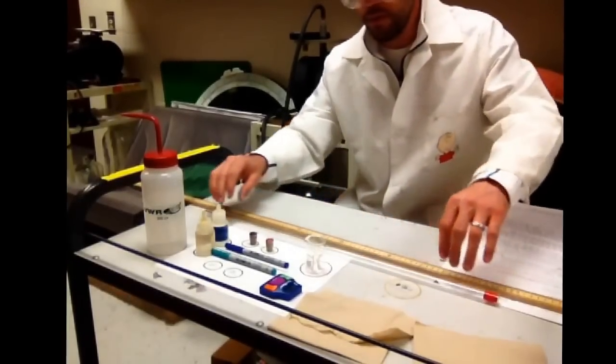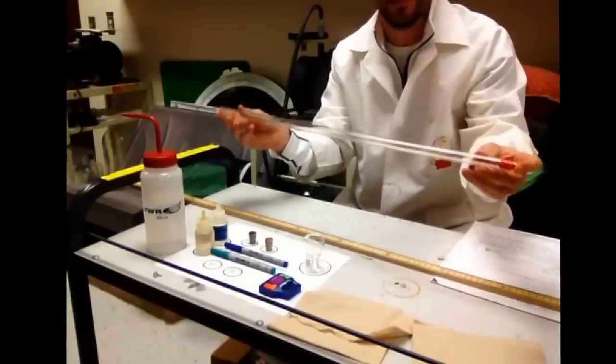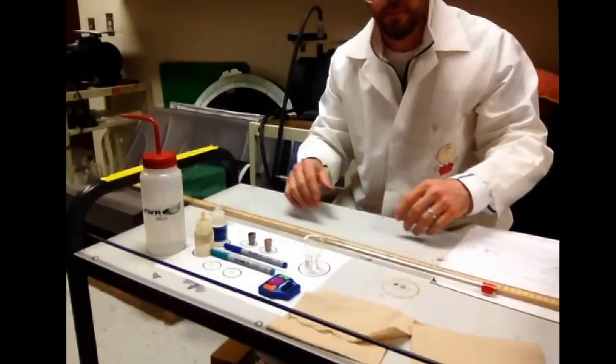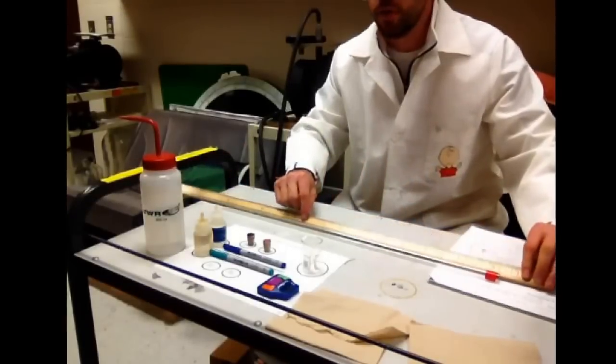What's some of the equipment? We have a long glass tube here with two open ends to allow the gas to travel down. We have a meter stick which we're going to use to measure the distance that the gas travels.